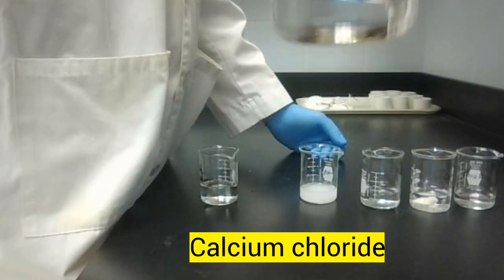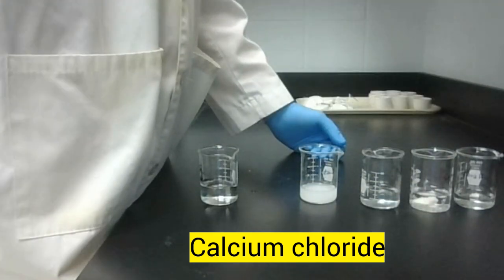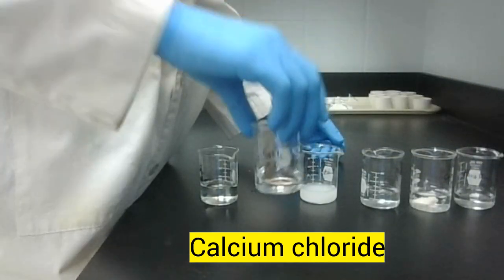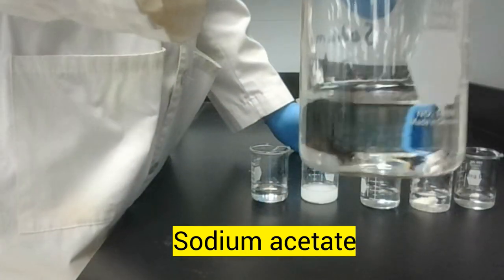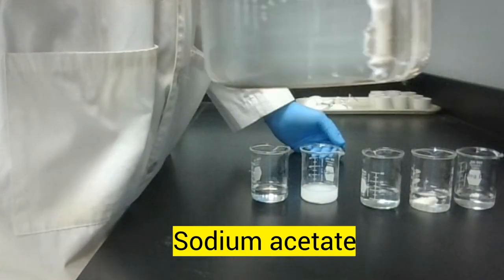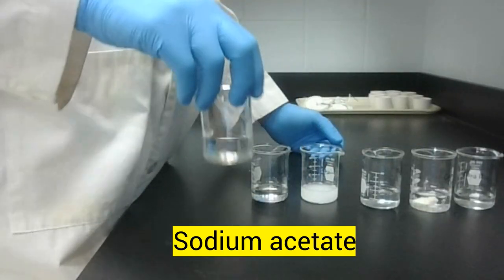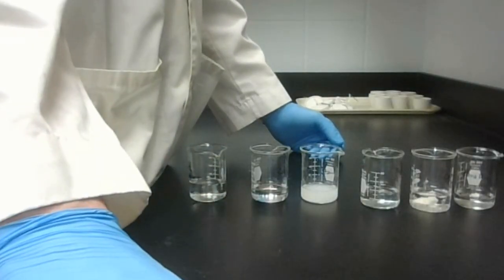The calcium chloride, though, those small white pellets, they are gone. They, in fact, did dissolve. Calcium chloride, absolutely dissolved. Very clear. It is soluble. And finally, the sodium acetate, likewise dissolved. No sodium acetate powder left. All turned clear in the solution and dissolved. Sodium acetate is soluble. Now we'll move on to our very last test.